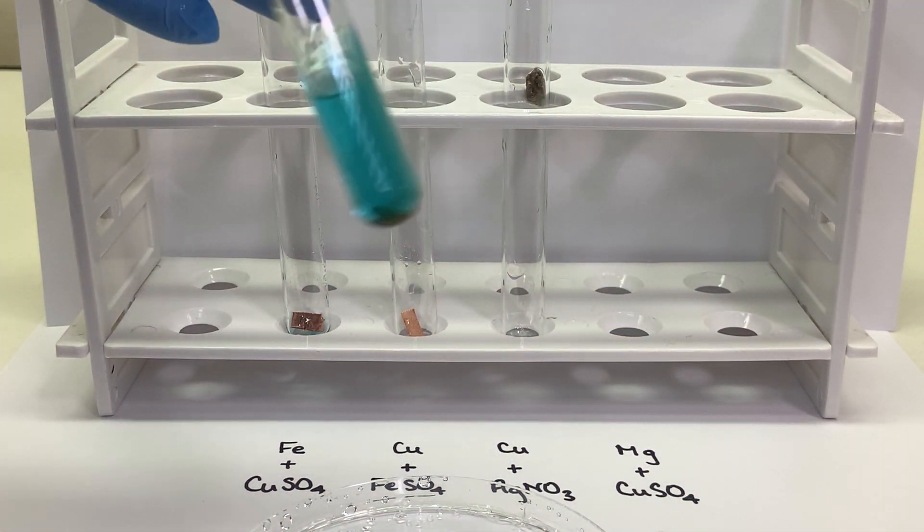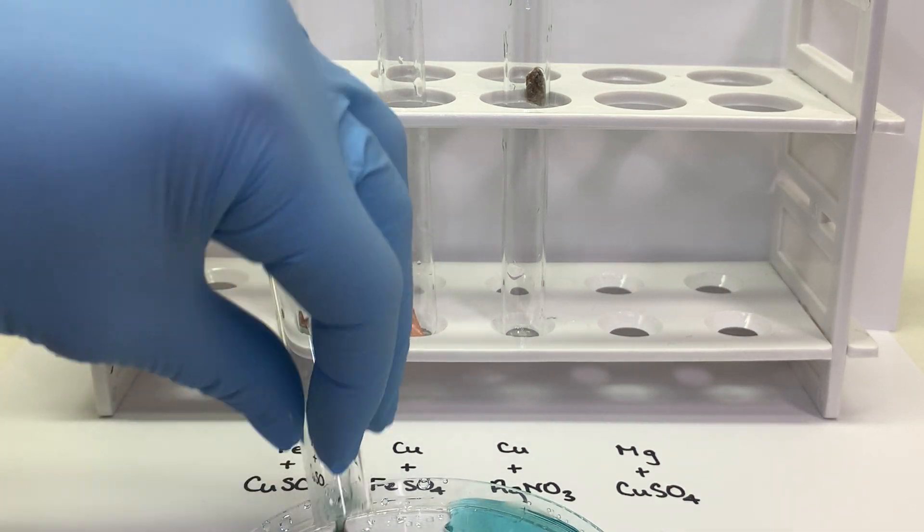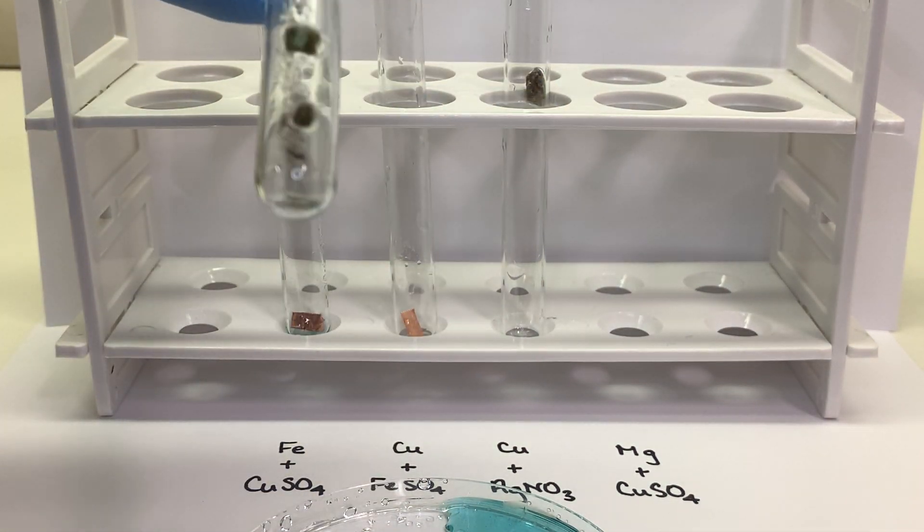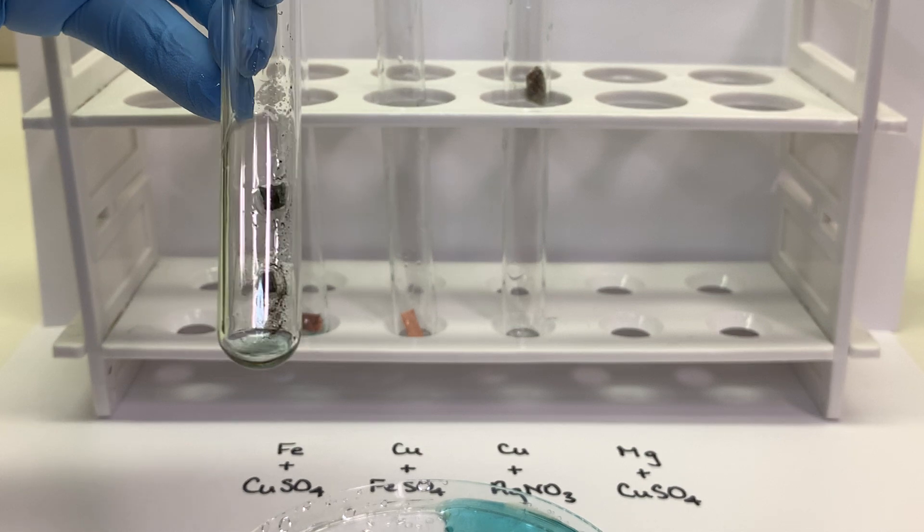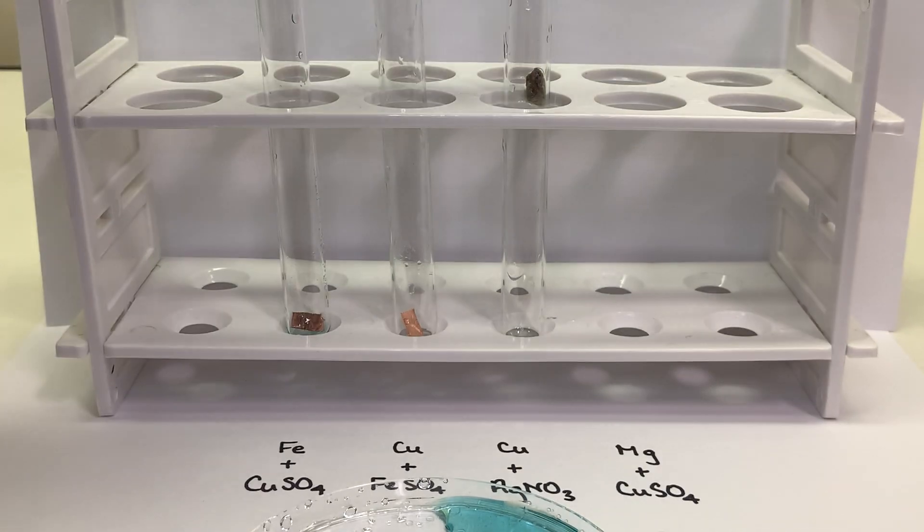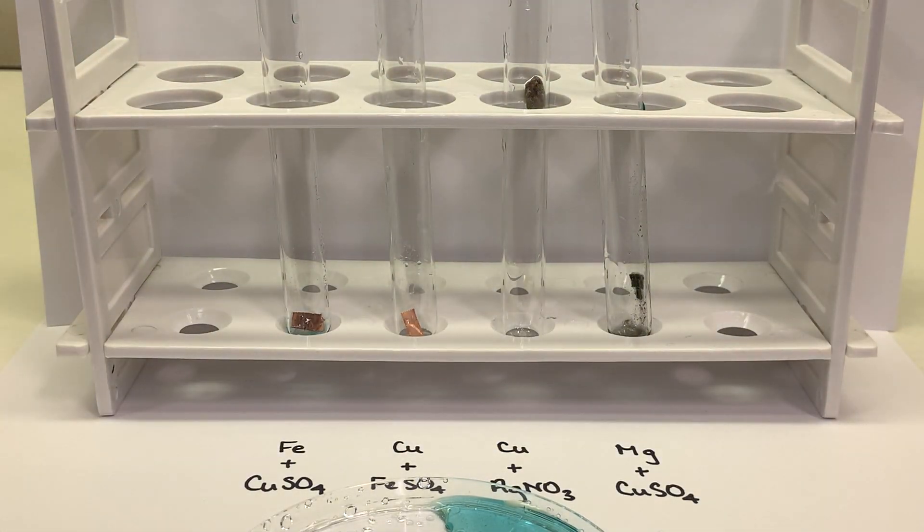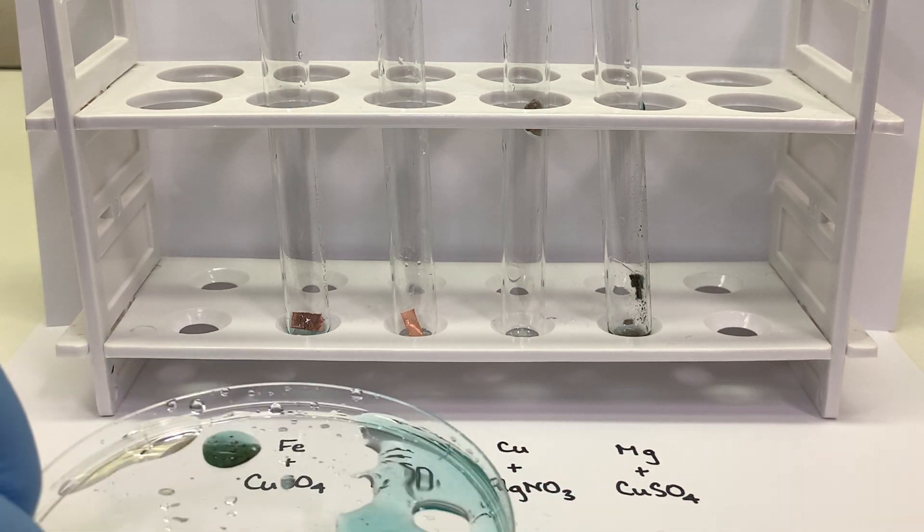And our last combination was magnesium and a copper 2 sulfate solution. The solid product had a hard time coming out, so I'm just going to hold that up there so you have a chance to make your observations.